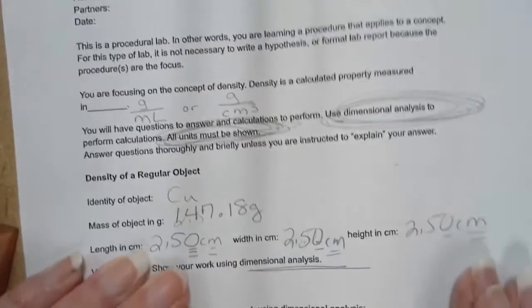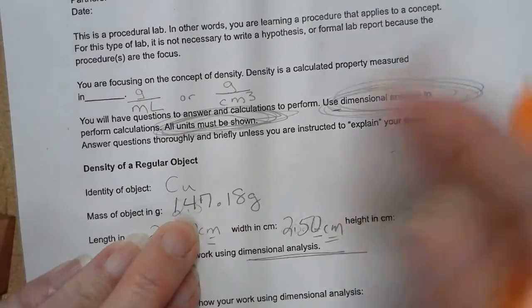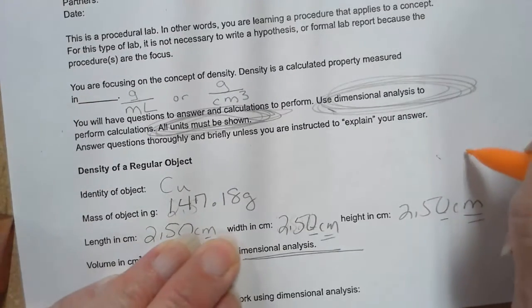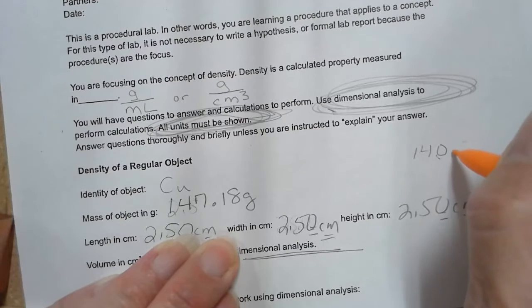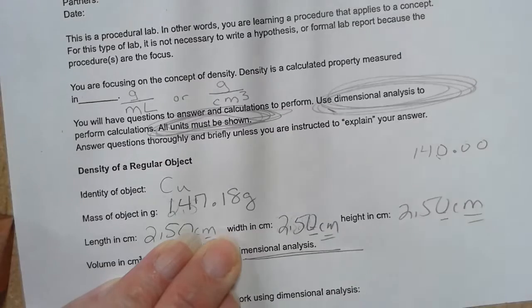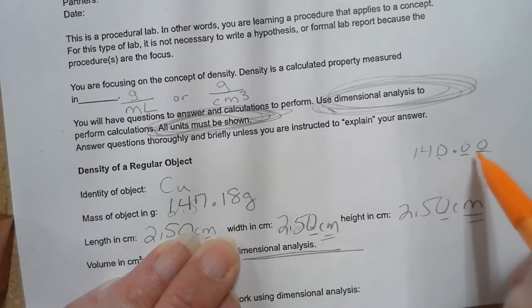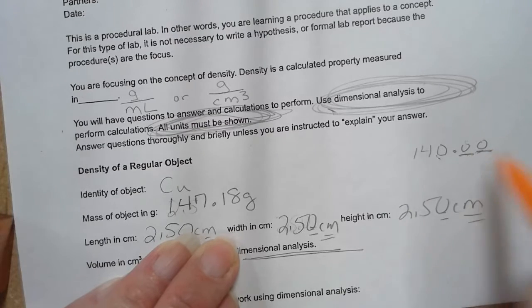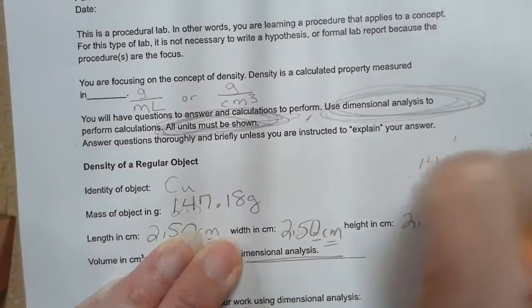Now let me remind you, let's pretend this number here turned out to be 0, so I'm just doing a pretend over here. Let's pretend that it ended up being 140.00. Because this particular scale measures with accuracy down to the hundredth of a gram, you would have to report the number like this, with both of those zeros, if it gave you that number.